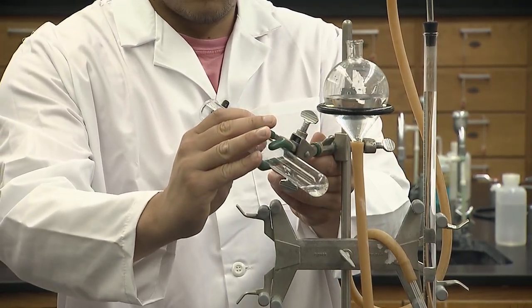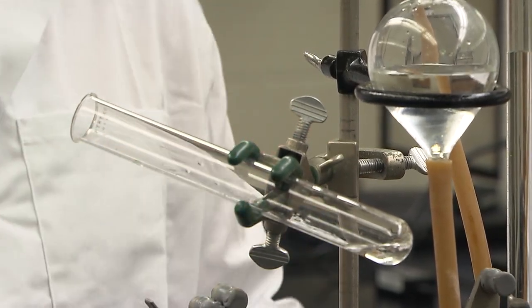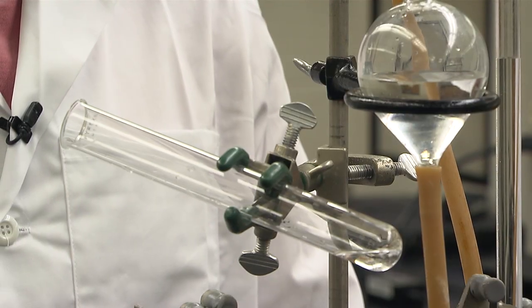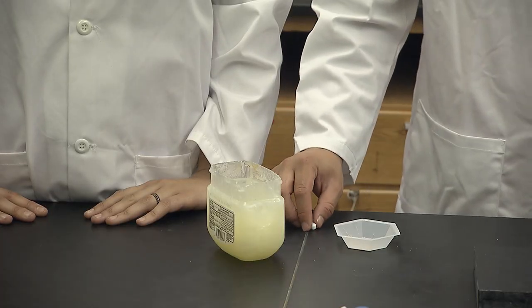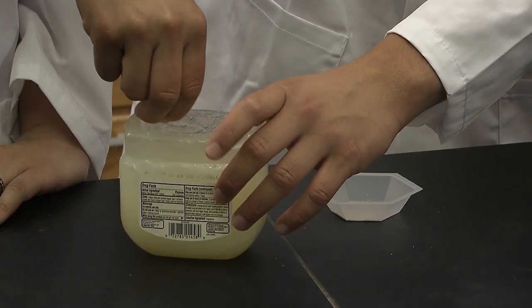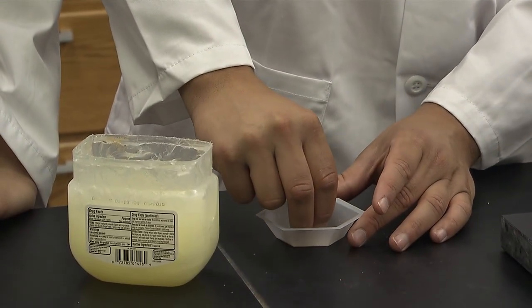Adjust the angle of the test tube to nearly horizontal while keeping the peroxide solution in the bottom. This allows us to transfer the reaction catalyst into the test tube and close it before starting the experiment. Baker's yeast contains the enzyme catalase, that is the catalyst. A little petroleum jelly is placed on one side of a small magnet, and it's rolled through the yeast.